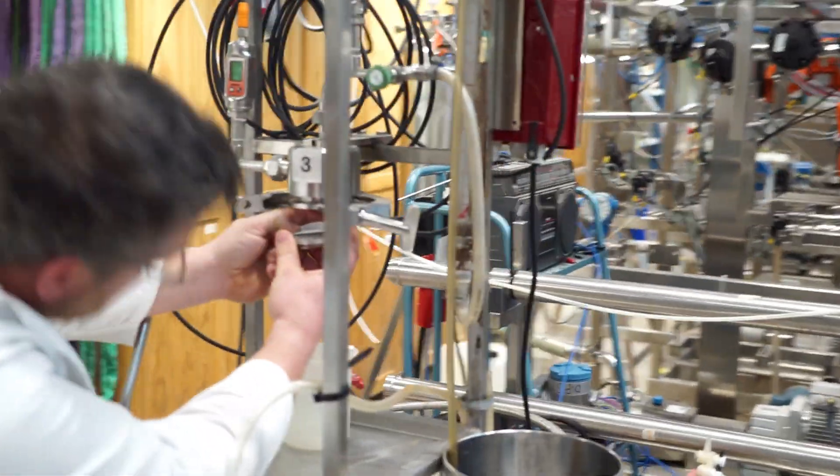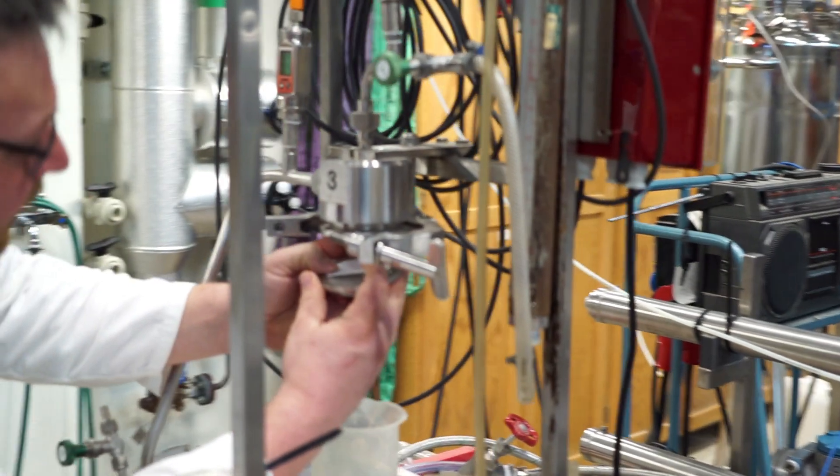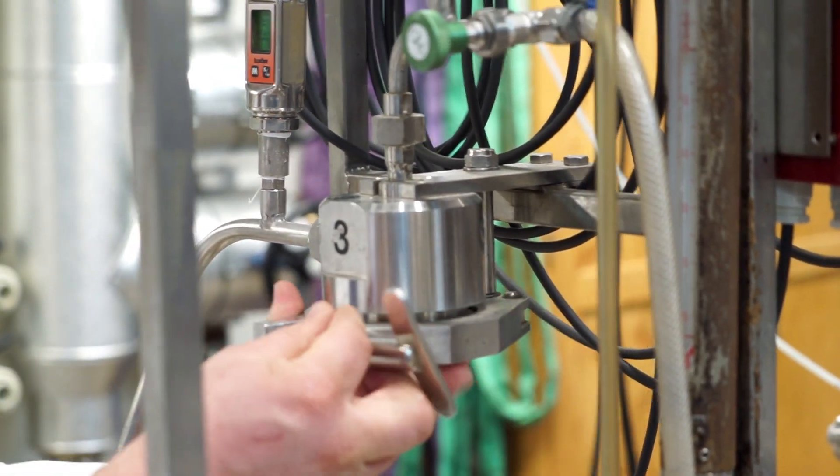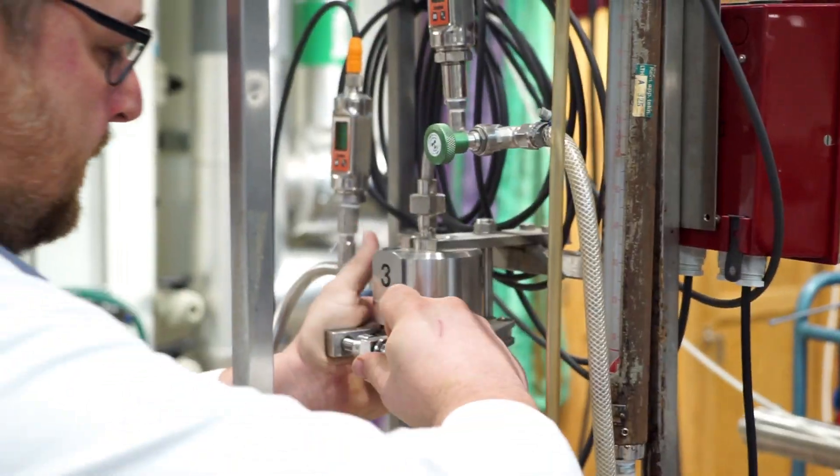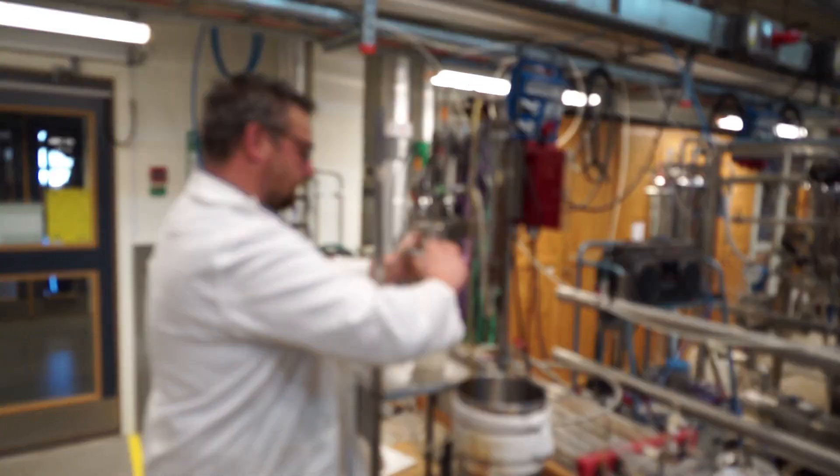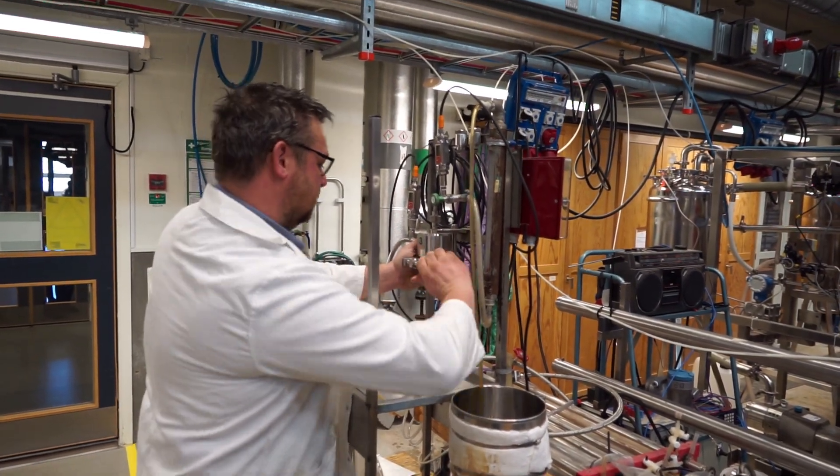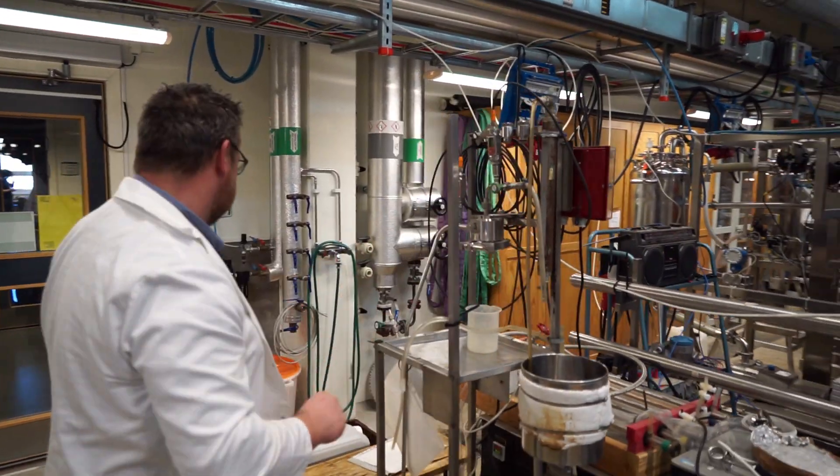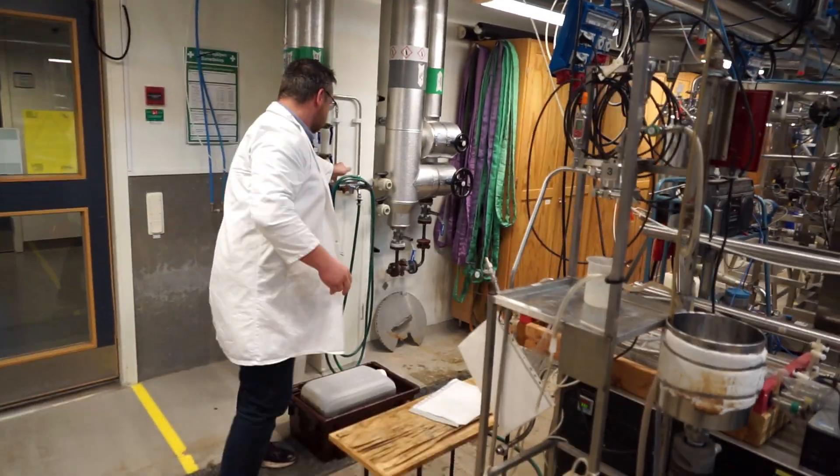And now the fiddly bit. It's a little bit fiddly, but it's not terrible. Now it should be tight. And now we fill up the tank.